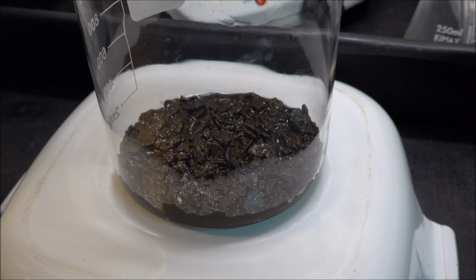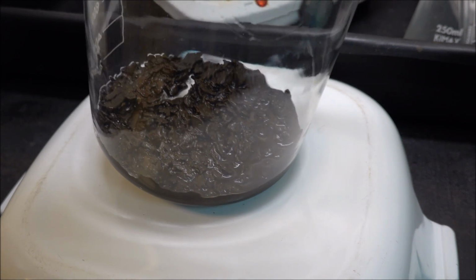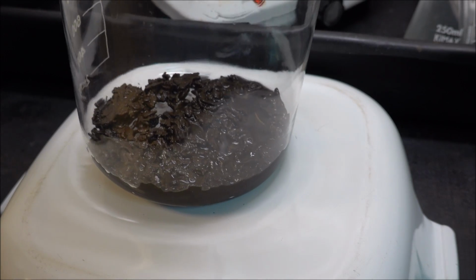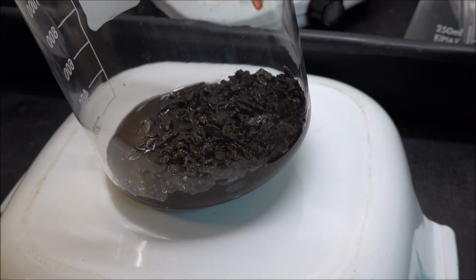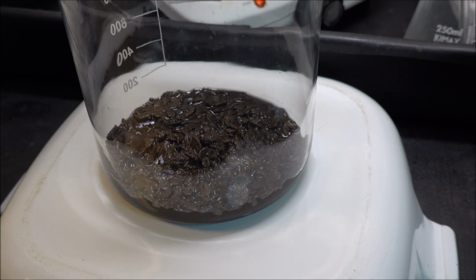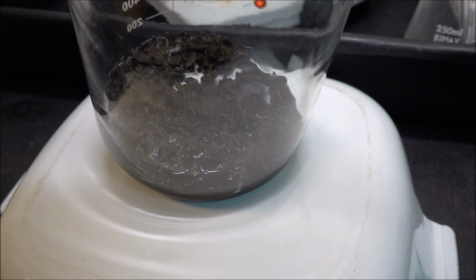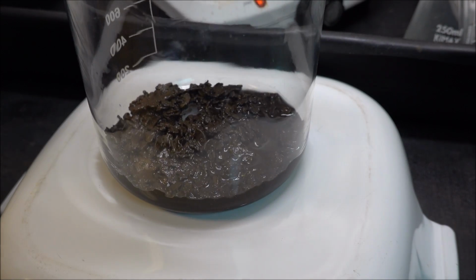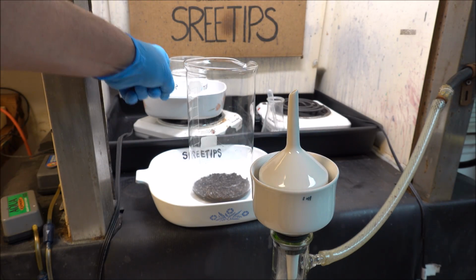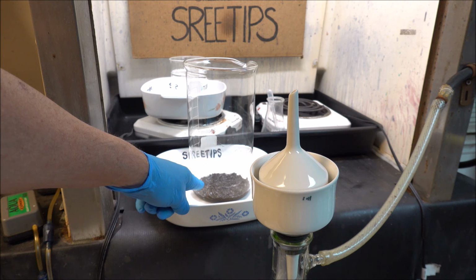The hydrochloric acid in the aqua regia will combine with the silver in that solution, form a whole bunch of silver chloride, and cause a lot of problems for us later on here in the process. I've got some distilled water heating back here. This is my gold that's still got silver solution mixed in with it.